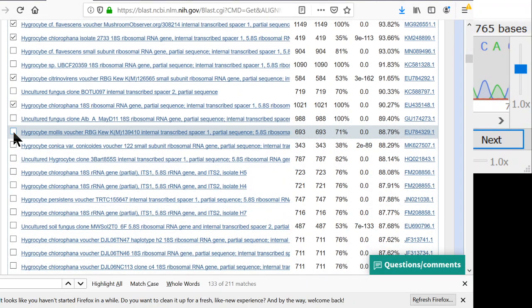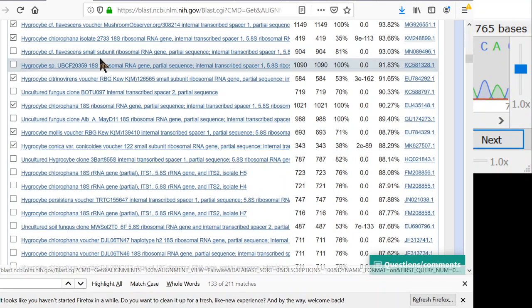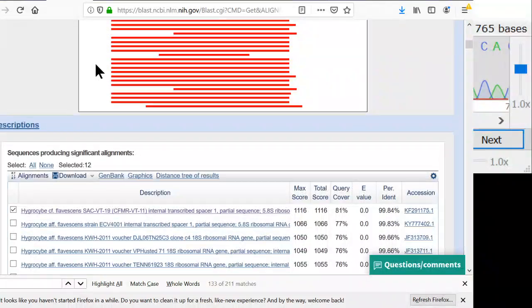So we'll just add whatever seems interesting here. Now, Hygrocybe conica is a black staining Hygrocybe, and that is in a different section of Hygrocybe altogether. So I'll select that, and we'll use that as our outgroup. And an outgroup is important because when you build a tree, you have an outgroup, which puts all the other sequences into context. So I think that's enough for just a little tree here.